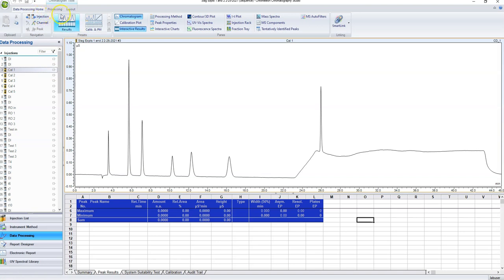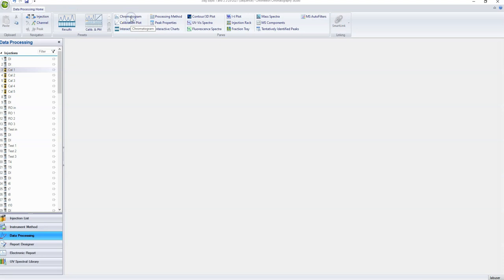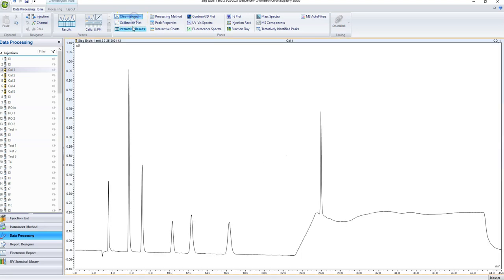This bar up here at the top pretty much determines everything that we see on our screen. The more things that you have selected up here, the more things that are going to clutter up your screen. The less you have selected, the more space you have to work with. If I get rid of interactive results, all I can see is chromatogram. If I get rid of chromatogram, I can see nothing. So I usually always keep the chromatogram up, and I use these other things based on what I'm trying to do. The main things that we're going to be looking at are chromatogram, interactive results, calibration plot, and processing method.